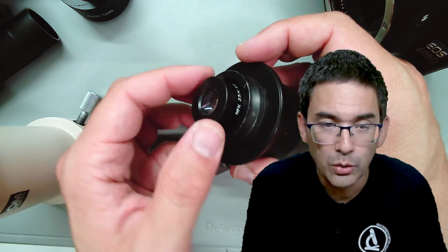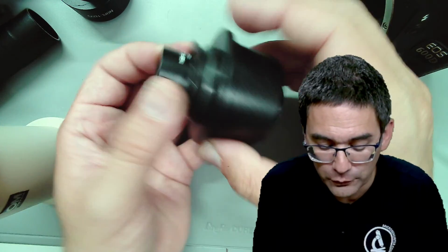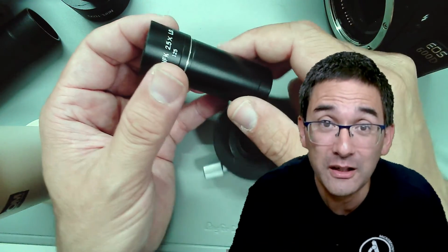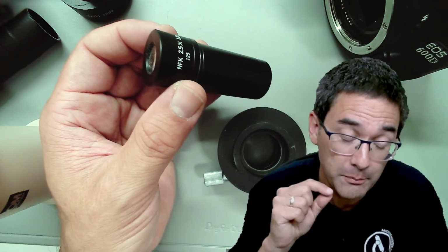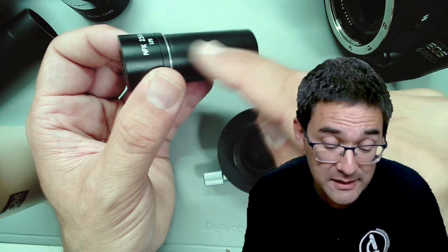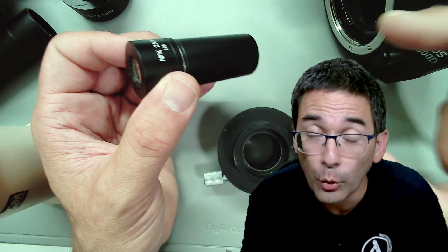This is a so-called photo projection ocular or photo projection eyepiece. They call it eyepiece, but it's not really for looking through. It's there to take the image from the objective and to project it on the sensor of the camera. Because this one is from Olympus, in the traditional Olympus system, which is not made anymore, and because the objectives had lens errors, it's a so-called compensating eyepiece or compensating ocular. This means that this ocular corrected the aberrations that the objectives made.